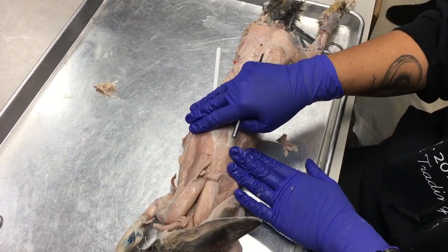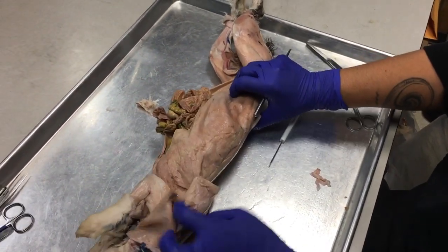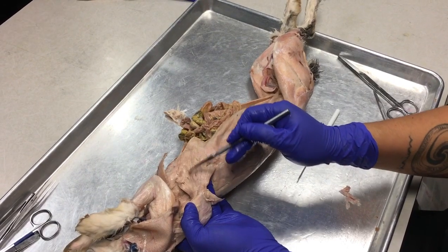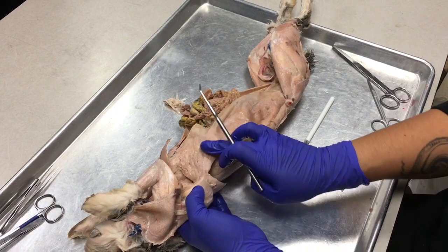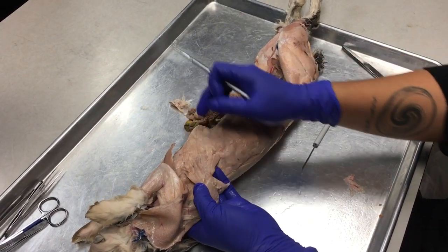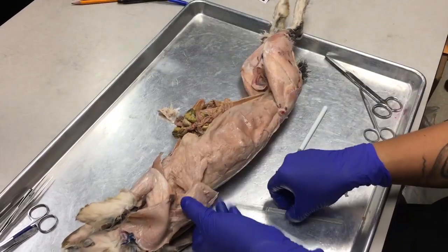All right, I have my latissimus dorsi here, and I'm going to peel it up and bring it over toward this way, and I'm going to take my shoulder blade and kind of stretch it out. Okay, look at these groups of muscles that have like these ragged, serrated edges here. Okay, there's a group that's connecting the shoulder blade to the oblique part of the lateral part of the bunny, and then there are other muscles coming up from the ventral area, and they're kind of interlocking with those dorsal flowing muscles.